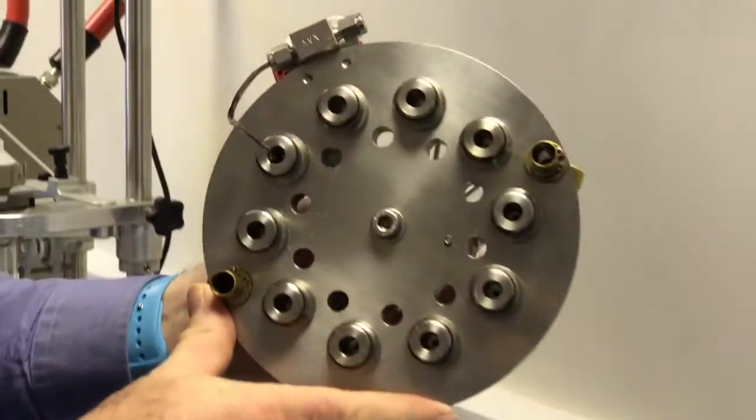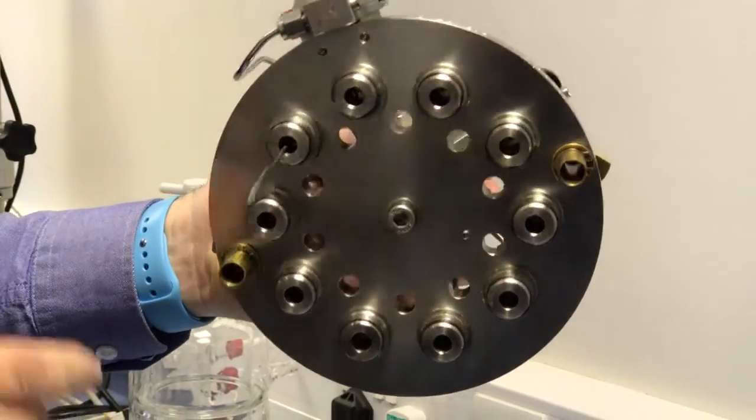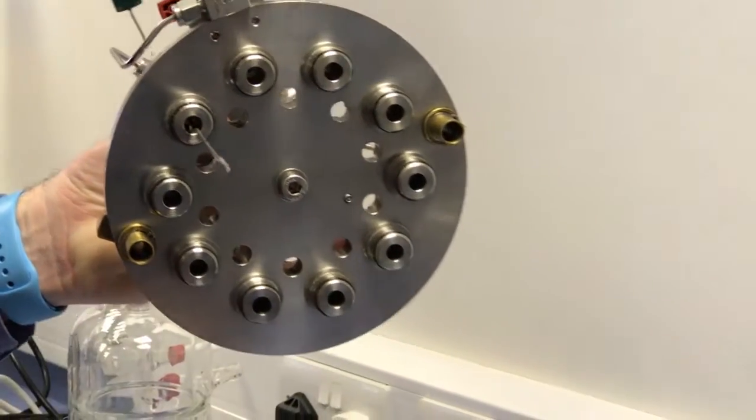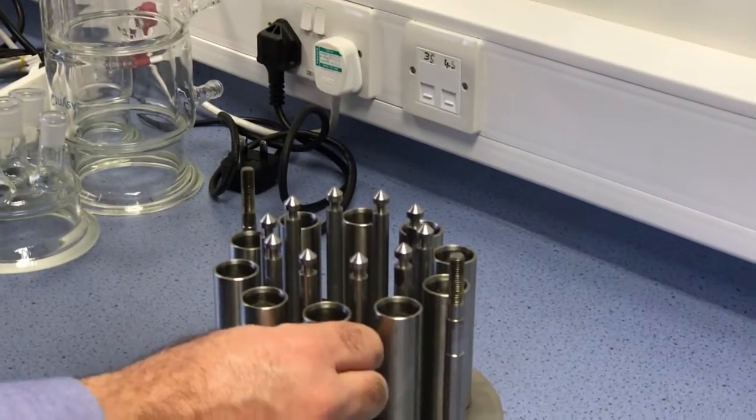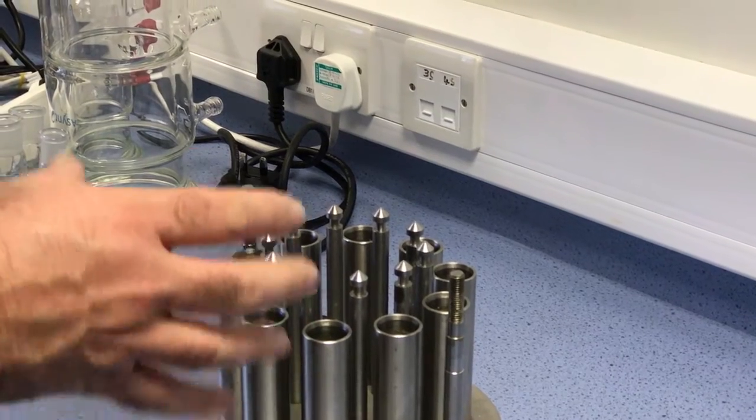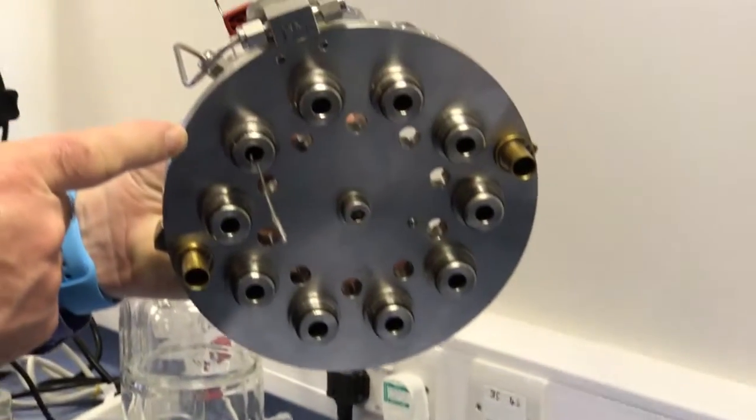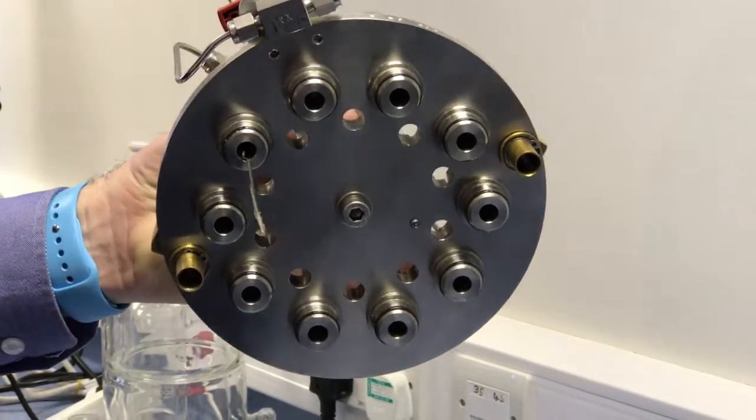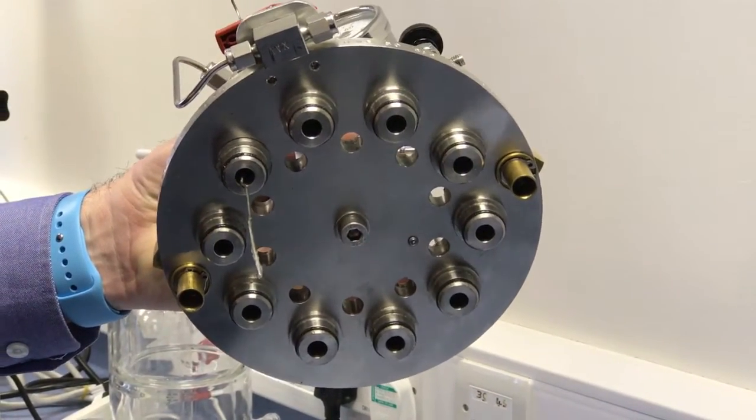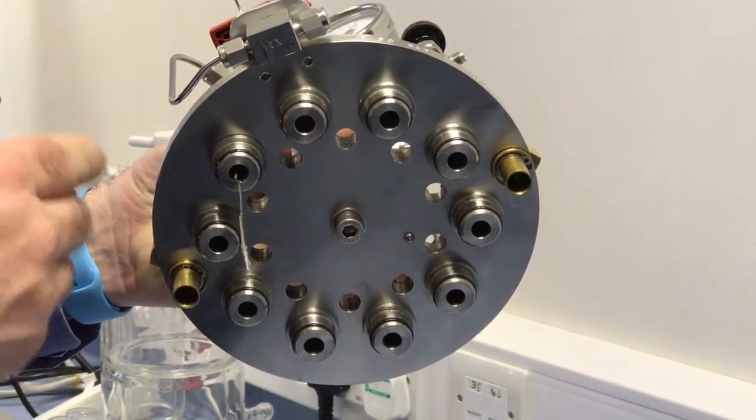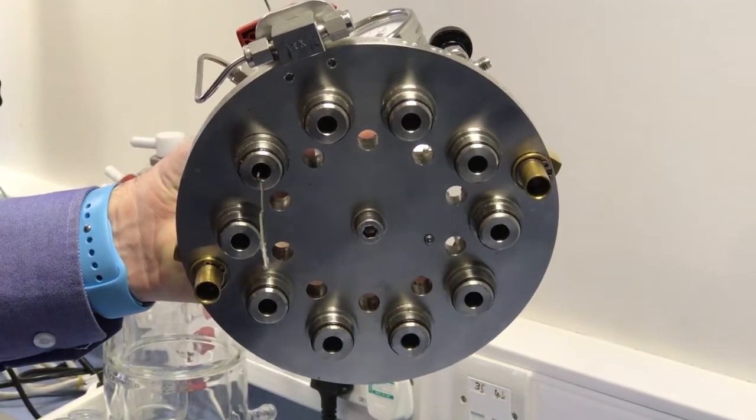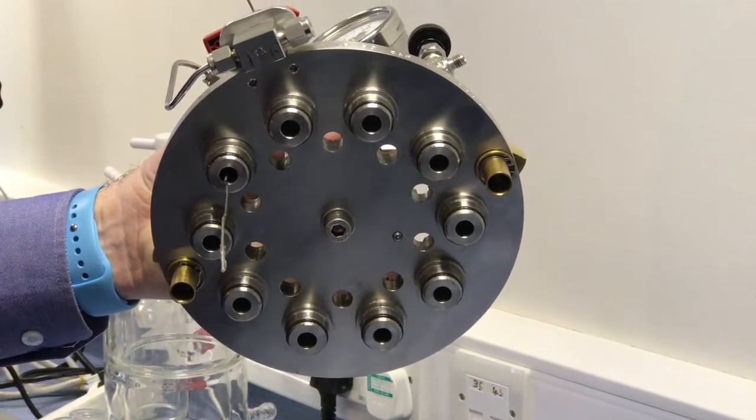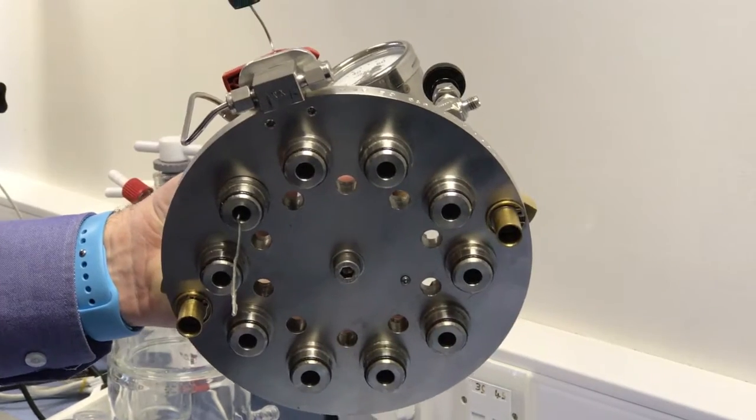Let me show you some of the other important things to consider with the multi-cell. Each of the reactor heads has an O-ring. The O-ring seals on the inside of the reactor vessels. For this to seal effectively it's designed such that the O-rings have to be energized to a reasonable pressure before they will actually seal. So until you get to two or three bar of pressure you may not have a full seal on every cell. It's designed to operate at pressures of normally 10 bar plus.